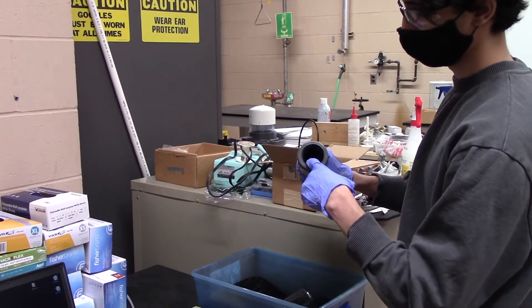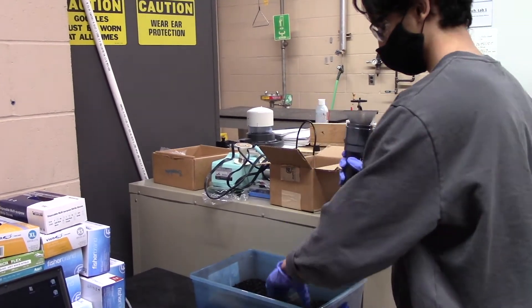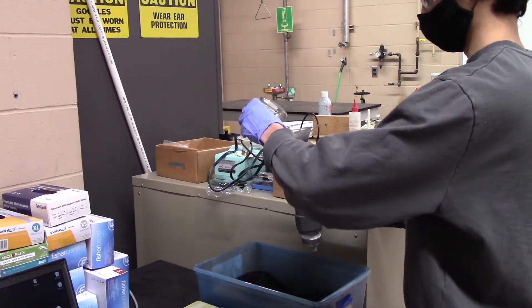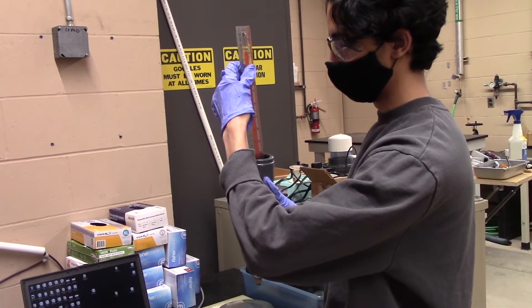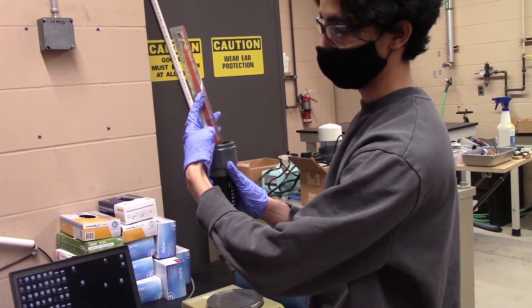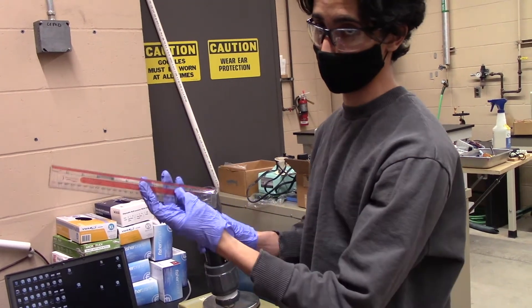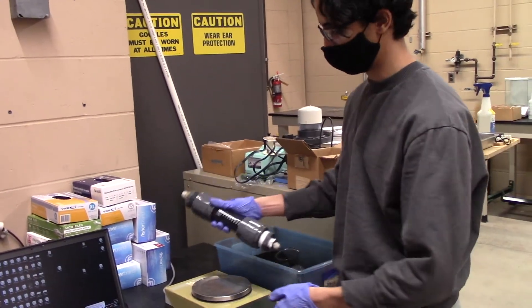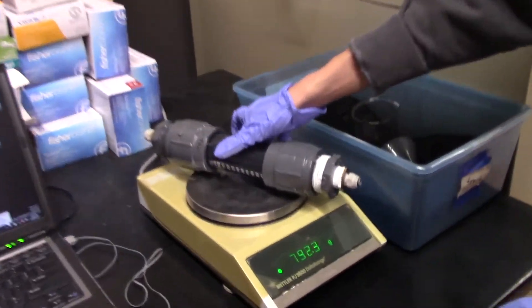Making sure you stay below the groove lines, fill the column with activated carbon using a funnel. Using the ruler from before, measure the top of the filled carbon to the top of the column and subtract this value from the column length measurement. Then tighten the cap once again and take the mass of the carbon-filled column.